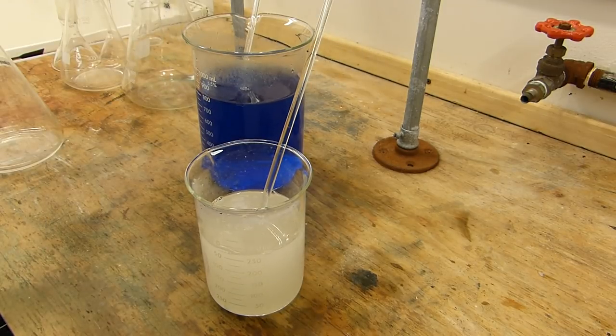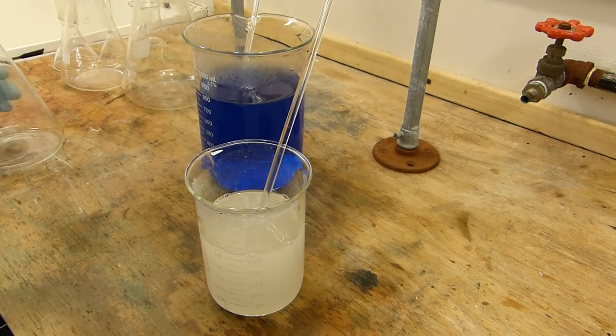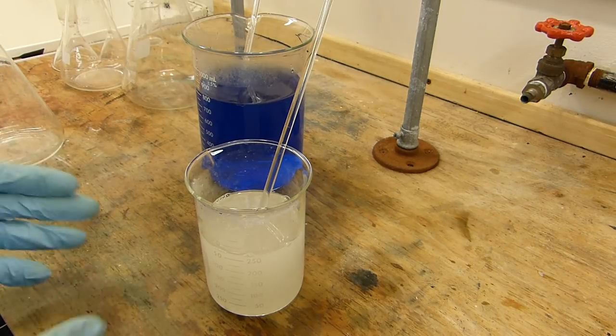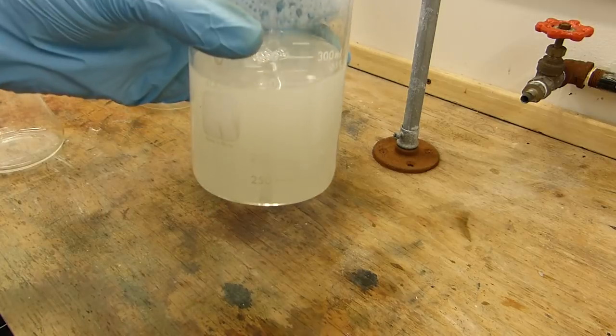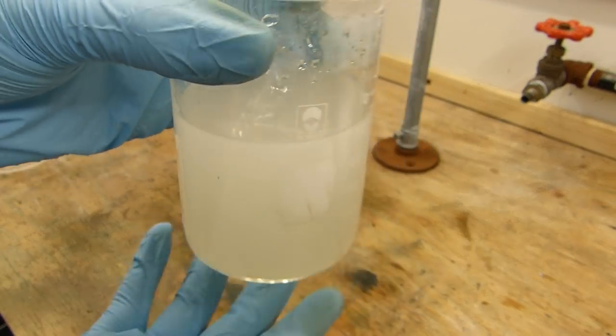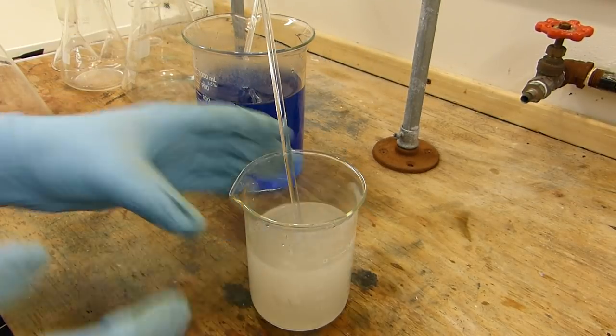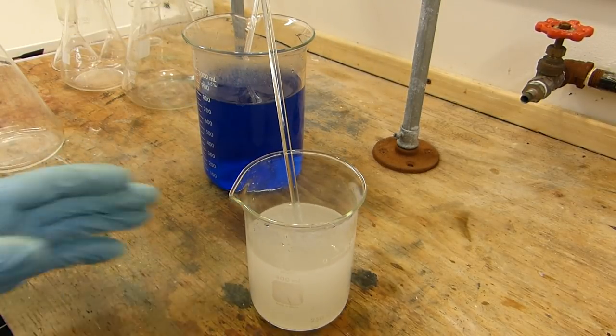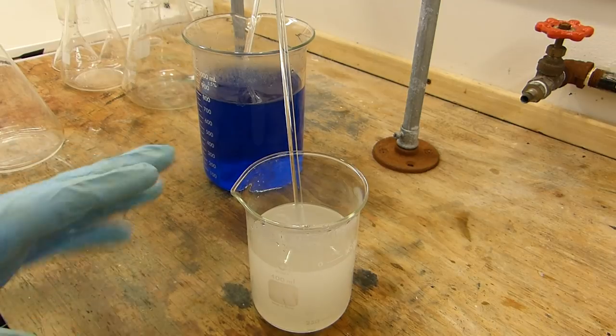There may be some calcium impurities in it, which cause it to not fully dissolve. So I'm going to go ahead and filter this really fast through a vacuum filter. You can use a coffee filter or something if yours looks like this, but that's simply a consequence of using technical grade reagents. You can also see there's a piece of dirt floating in it right there. And since our final product is, we're going to filter our final product from the reaction mixture, all this stuff will end up in there if we don't filter it out now.